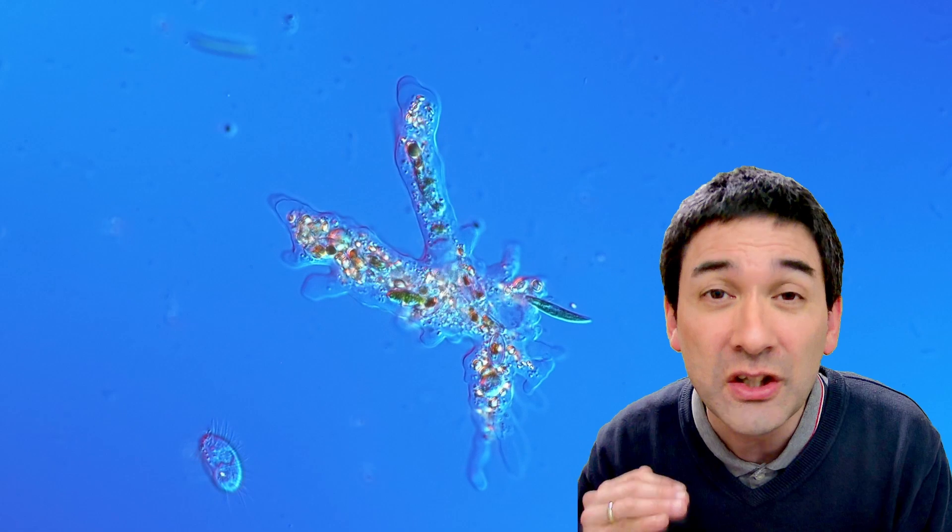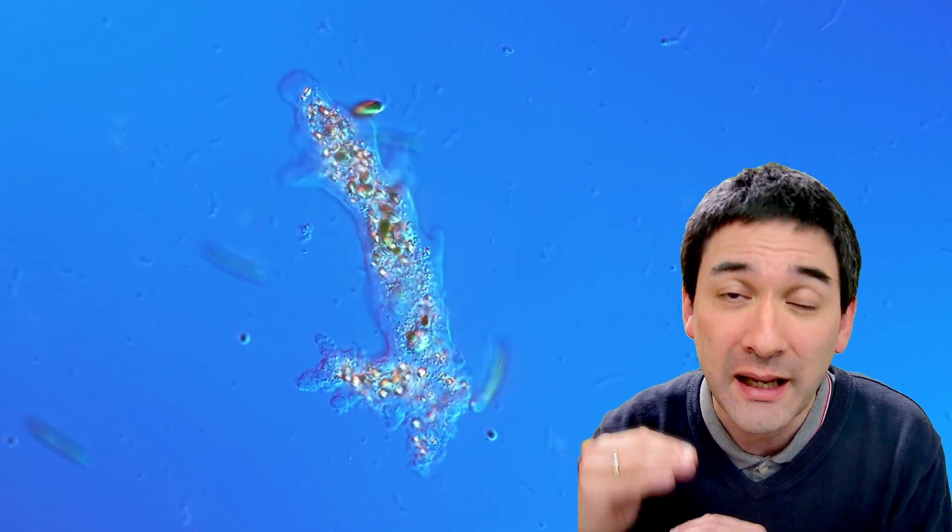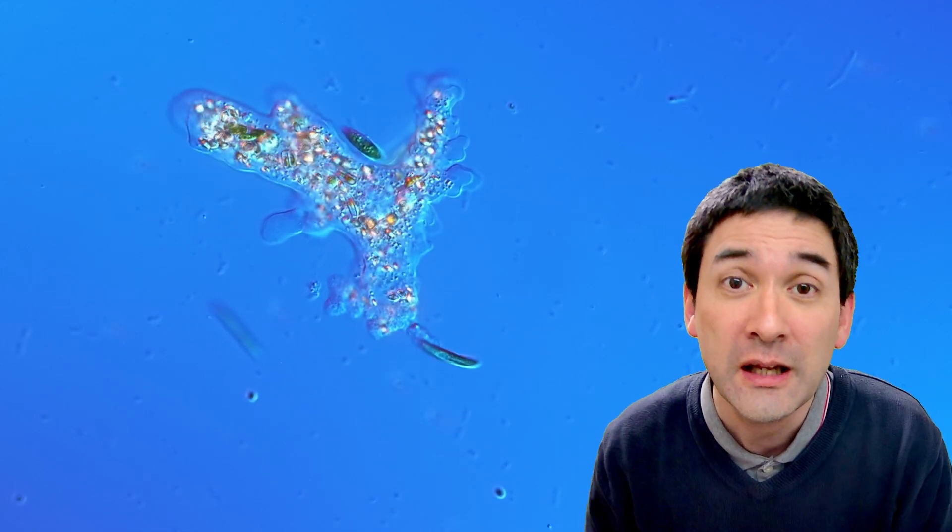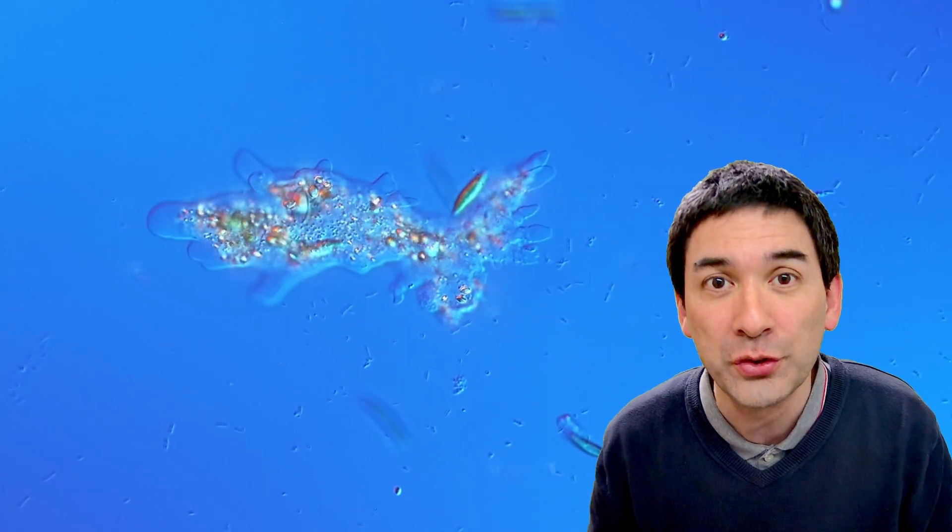Today what I'm going to do is squeeze it by really reducing the amount of water, and this really presses them down because the cover glass applies a lot of pressure here. What happens then is that the cell will pop open and the contents are going to be spilled.